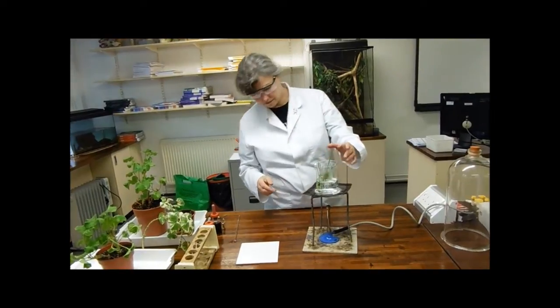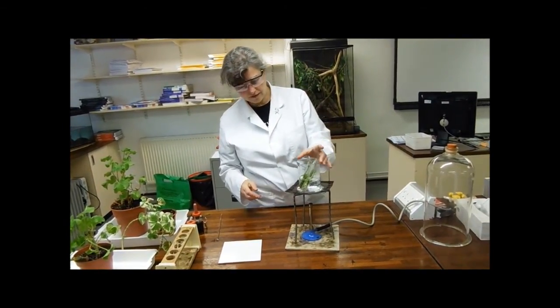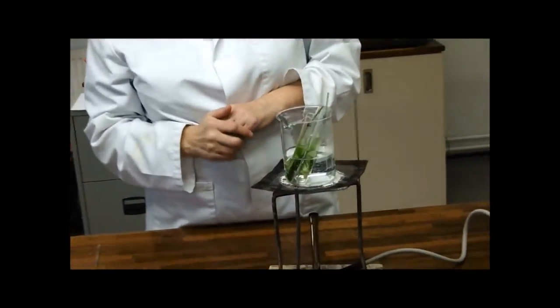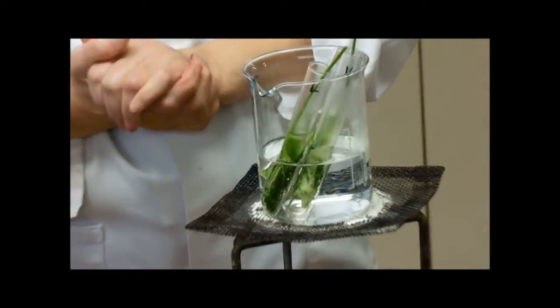And it's now, I don't know whether you can see that, that ethanol bubbling very nicely. And we should see the ethanol start to turn green.